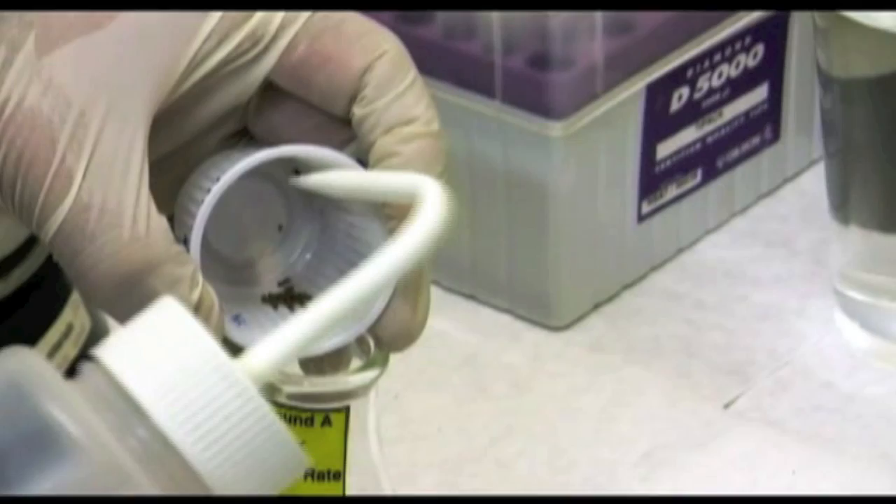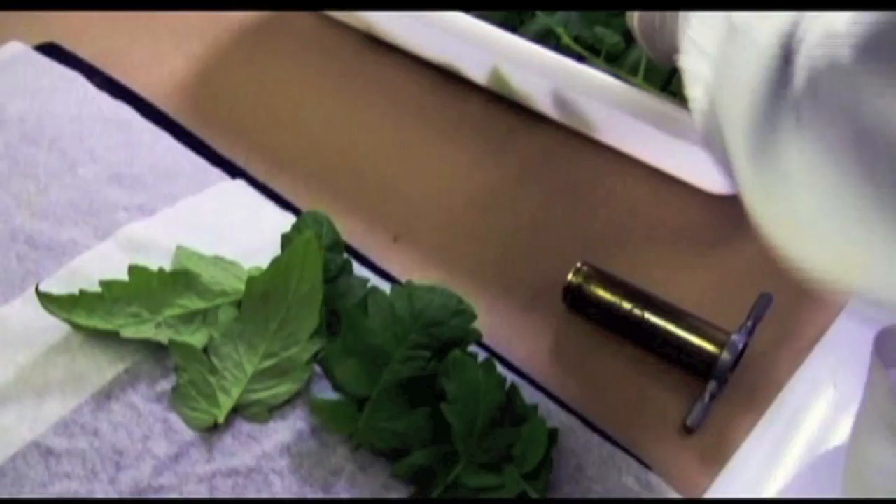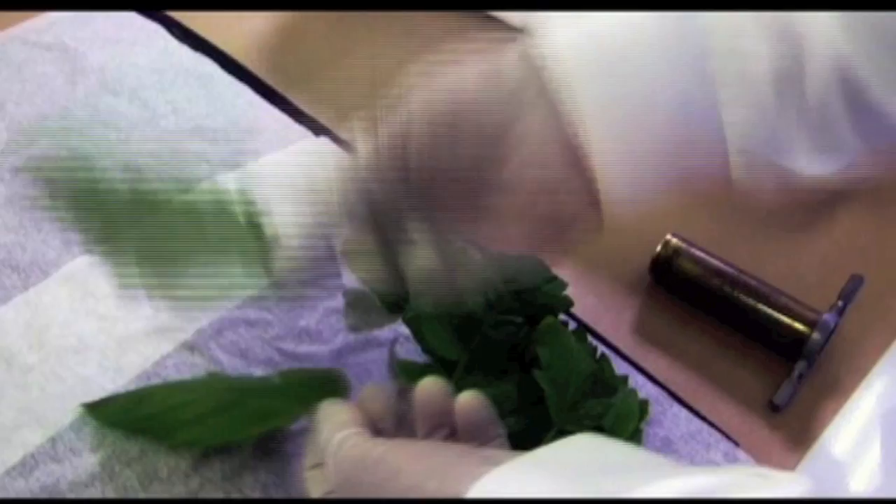All vials to be used should be clearly identified with visible labels. In order to standardize leaf damage evaluations, it is important to choose leaflets of a similar size.